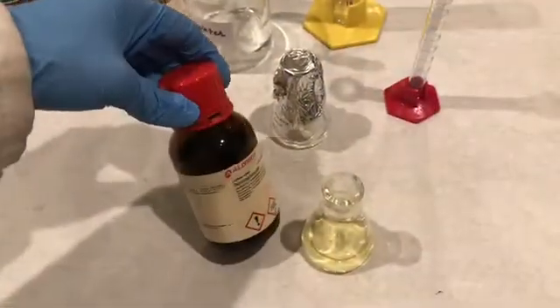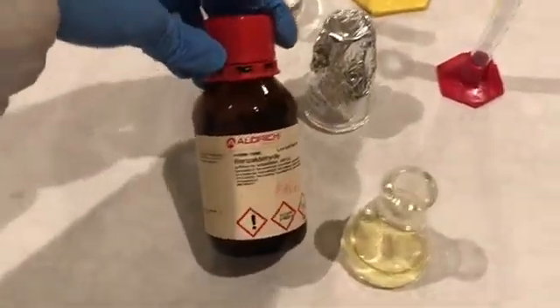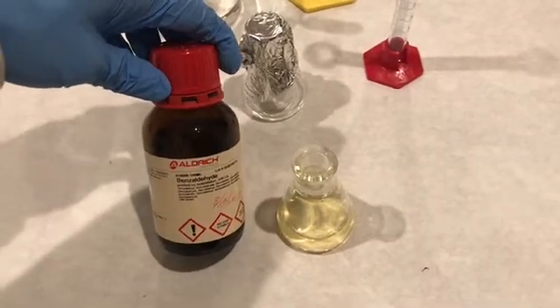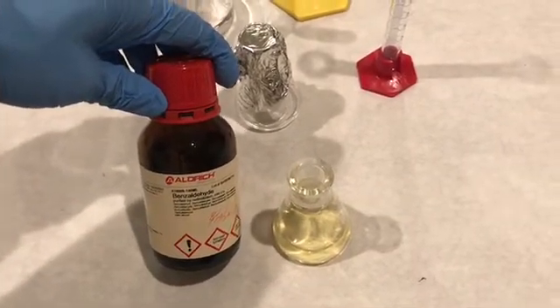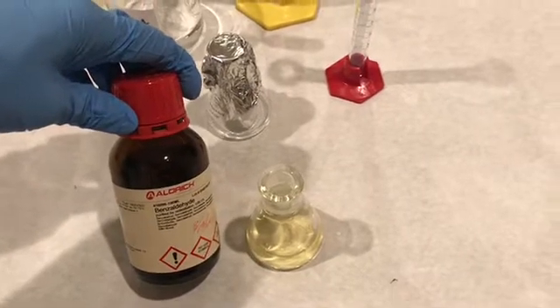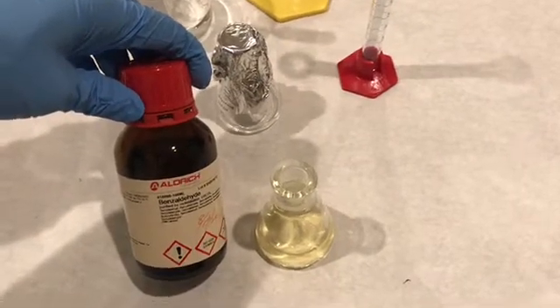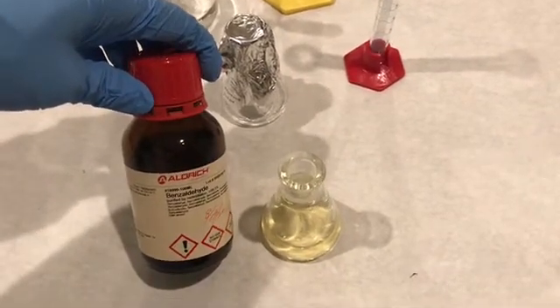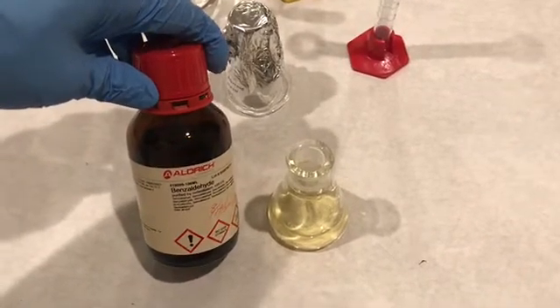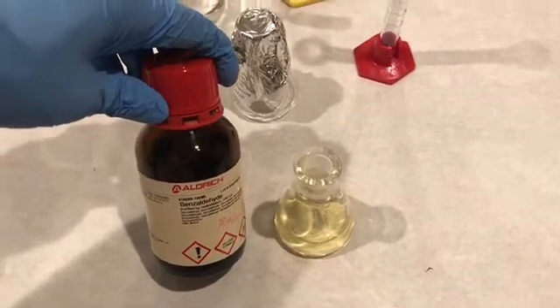Now I am going to add the benzaldehyde into this solution. I opened this bottle fresh because benzaldehyde can be oxidized to benzoic acid, so we need benzaldehyde that is not contaminated with any benzoic acid. I will transfer about 4.5 milliliters of the benzaldehyde to this flask.